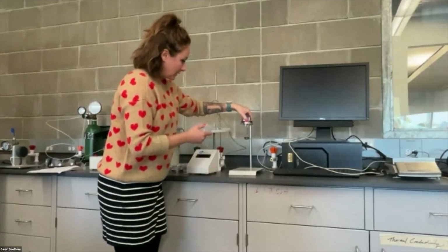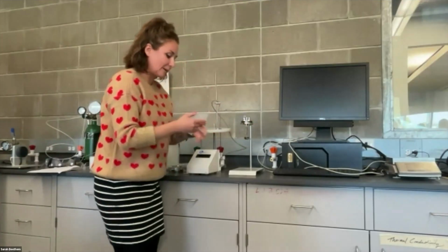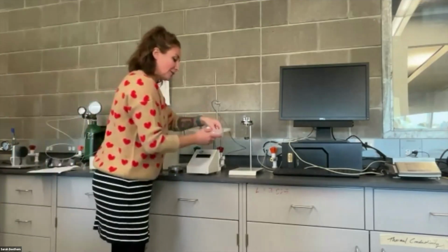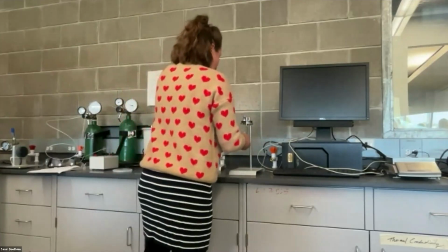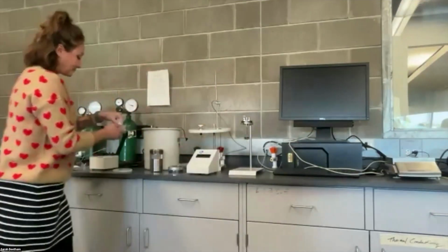All right, so I'm going to set my crucible cup in this little holder right here. And I find that it's easier to orient it like this, so it pulls out a little easier without having to twist it when the sample's in there. This part's a little bit like Operation, but you just want to kind of scoop up your sample with the paper and then get it into the cup without touching it, okay?